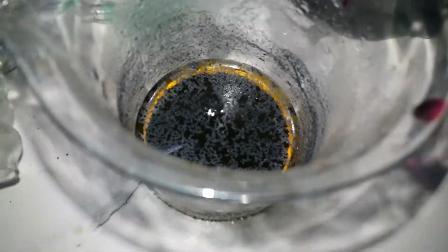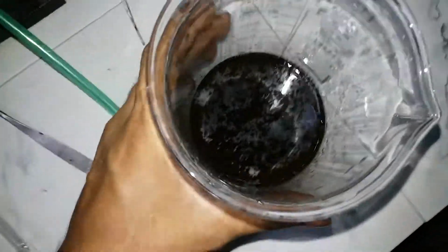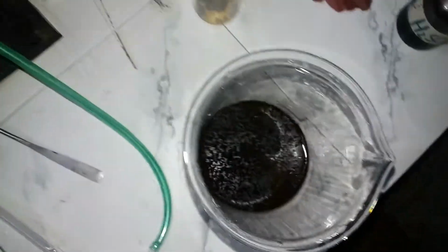So as you can see, I'm just washing the iodine, and there's the iodine, and there's the decanted liquid with some iodine. Yes, there is gonna be some loss. Well, I got all my iodine in the funnel, and there's the decanted liquid, and there is a huge loss. I'll try to recover some from it, but, well, I'm still disappointed it didn't work out in the first place, and I lost a heck of a lot of nitric acid.